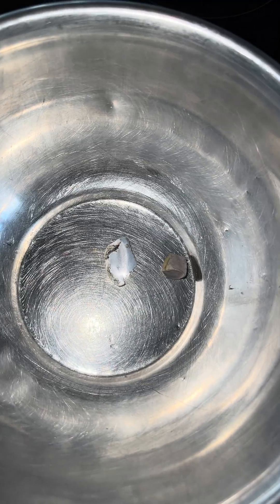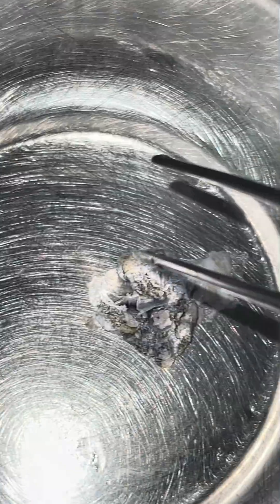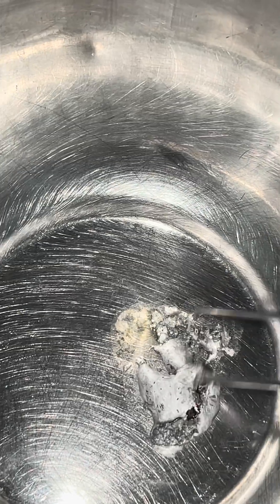Now we're gonna melt them together. Sodium has a melting point of 100 degrees Celsius whereas potassium has a melting point of only 60 degrees. We're mixing it up — potassium and sodium mix, we're calling it 'polsium'.